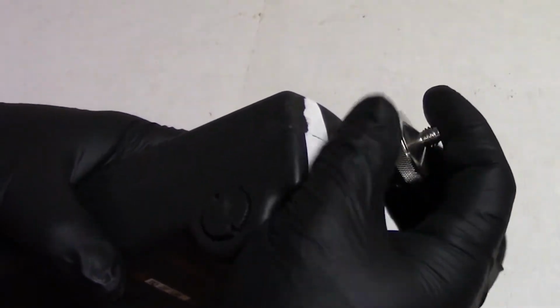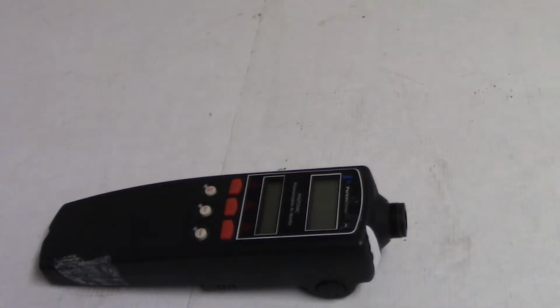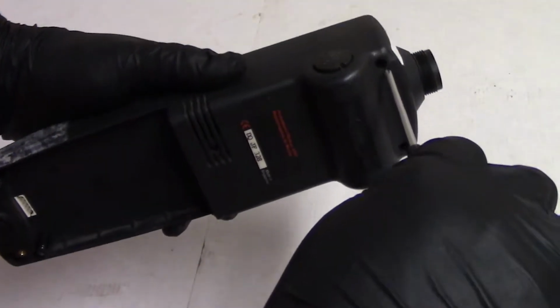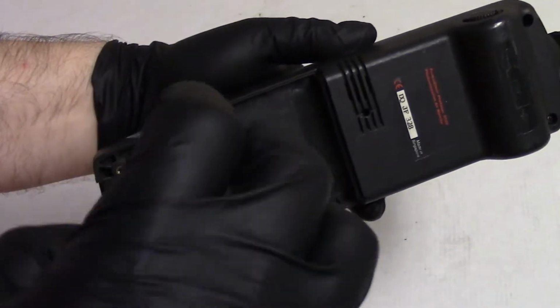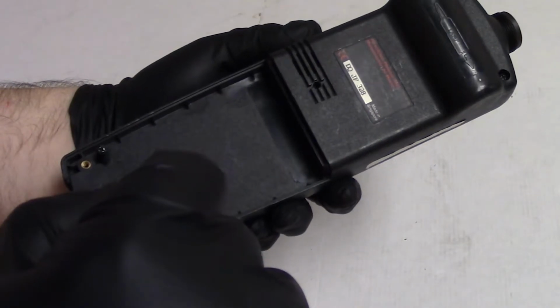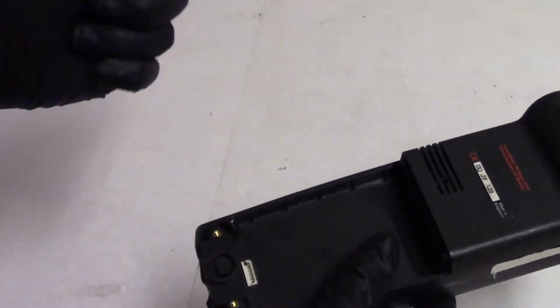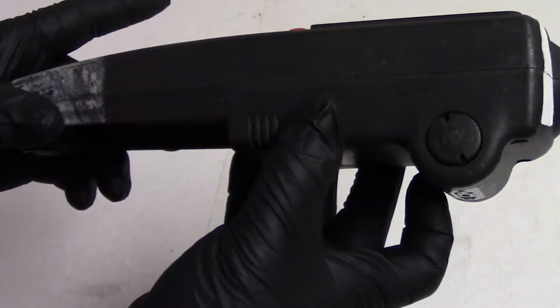So anyway, let's get inside this thing. We'll take the straw adapter off, and I'm just going to push the filter inside there so I don't lose it. Then there's only a few screws. One, two, three, and four. And then those two. And that's it. That's all that's holding this together.